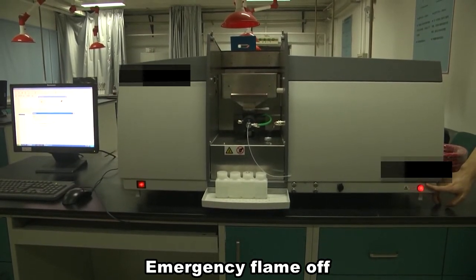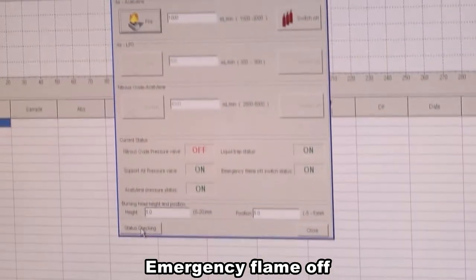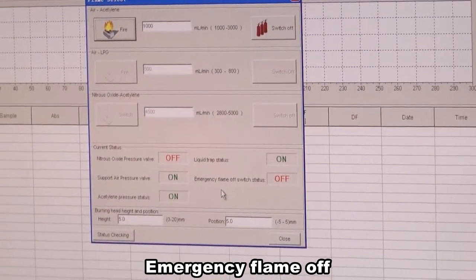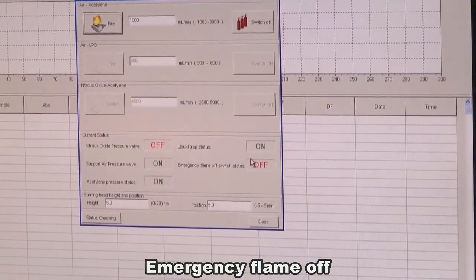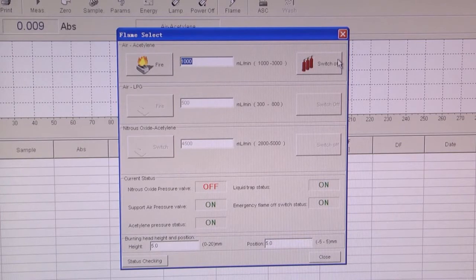The button is on and the flame is off. Then we check the status again. Here it shows emergency switch is off. Also, we can use this button to switch off flame.